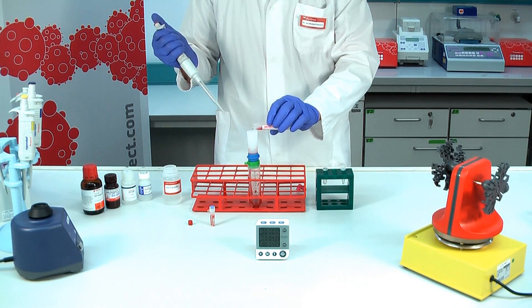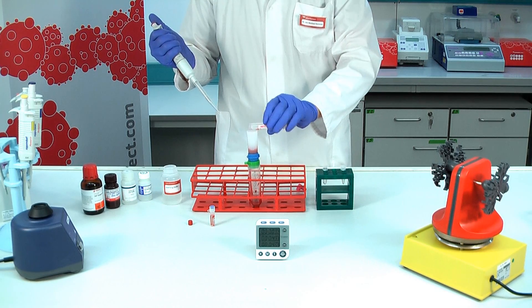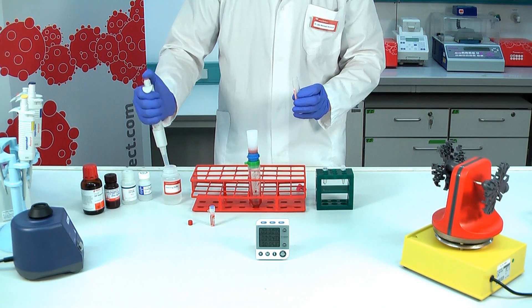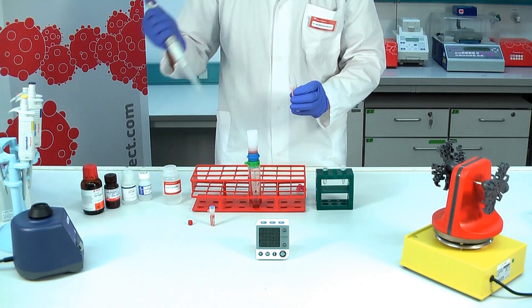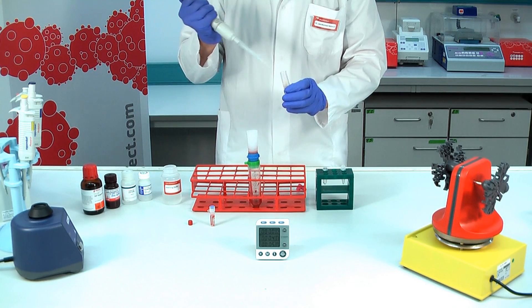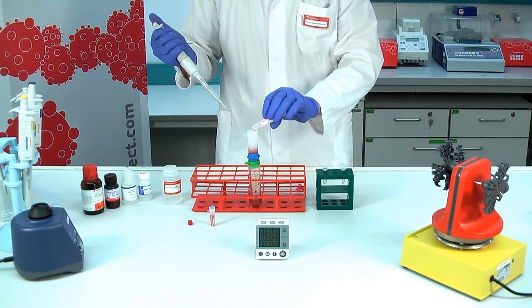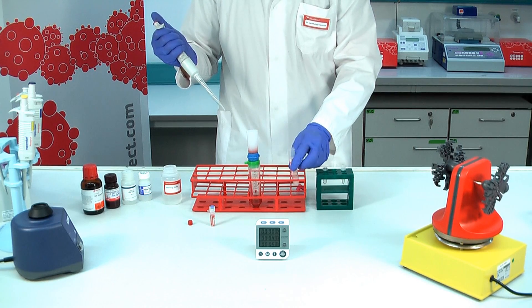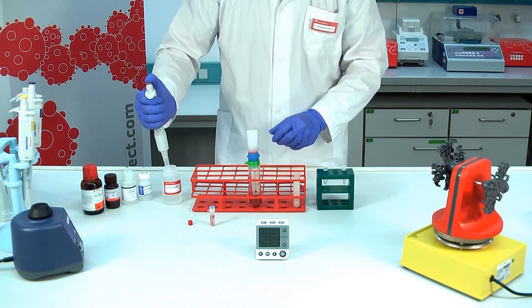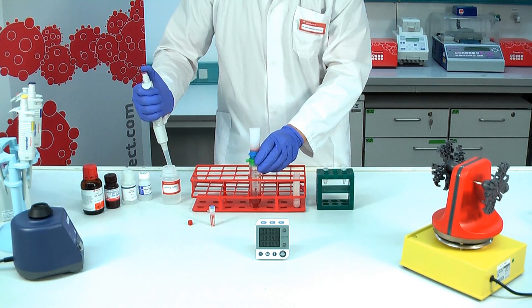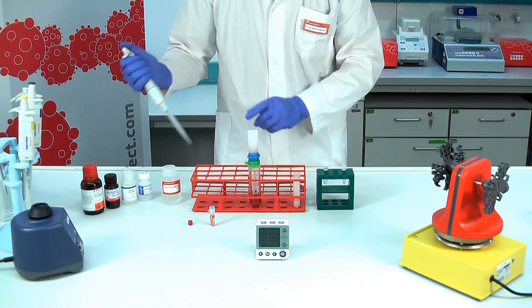Wash your blood collecting tube sufficiently. Wash the funnel.